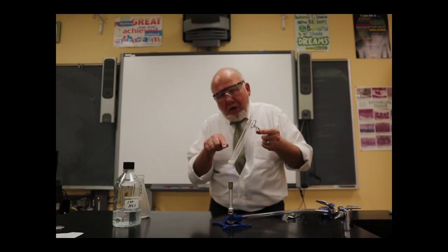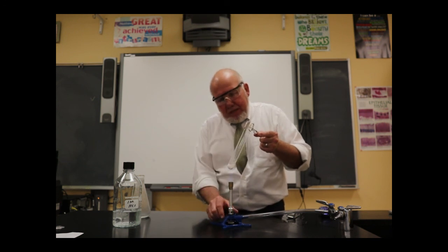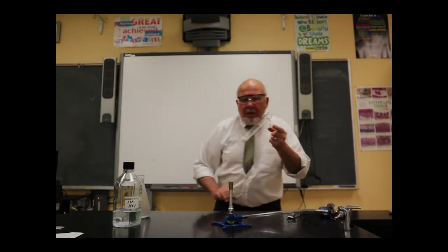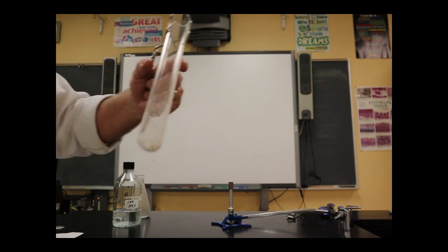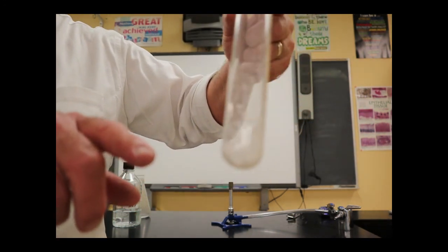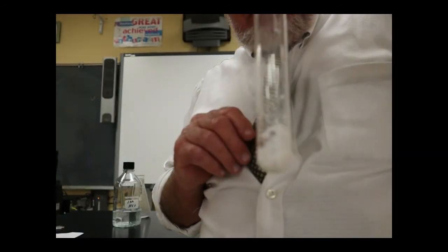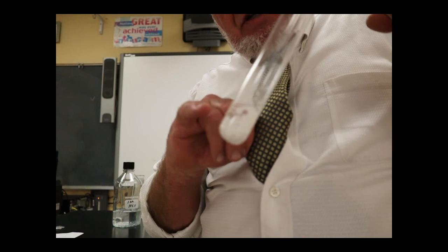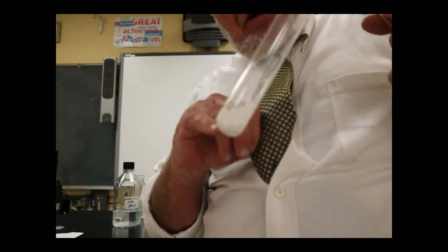Right, there's my solid. There's the magnesium chloride. It appears to be pretty hot. Let me bring it over to the camera. I'm going to be careful not to touch that. But that's the white solid. I'm standing behind it so you can see it. So there it is, the magnesium chloride. That's where the magnesium atoms are now.